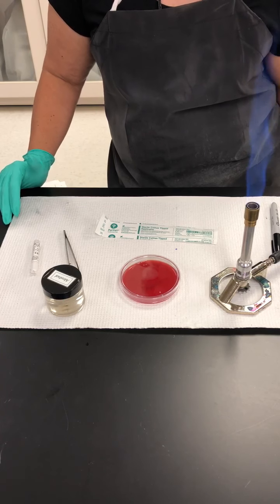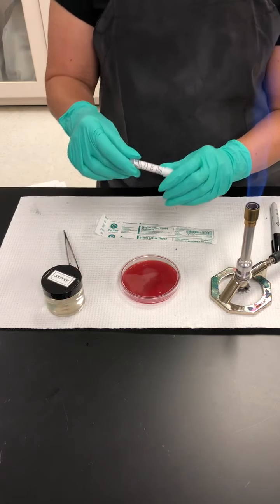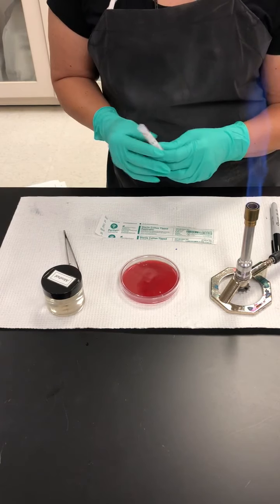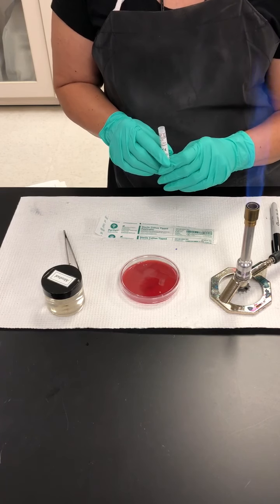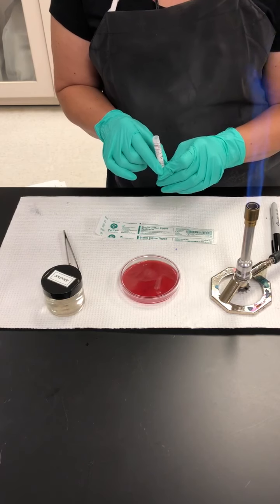Demonstrate how to set up antibiotic sensitivity testing using antibiotic discs. We do this when we're in between two organisms and we're identifying unknowns. More than likely, a similar setup is also used when we're trying to determine antibiotic sensitivity in the Kirby-Bauer test. But that's not what we're doing today.